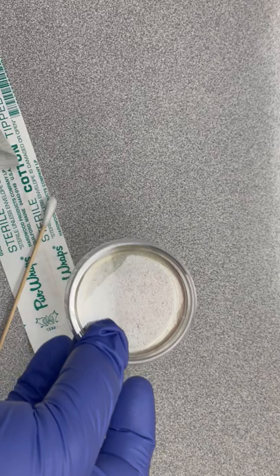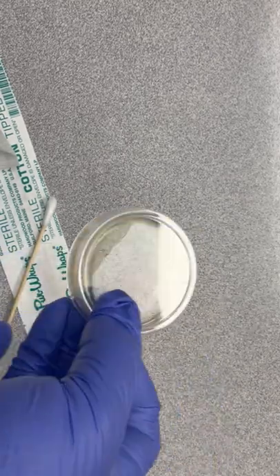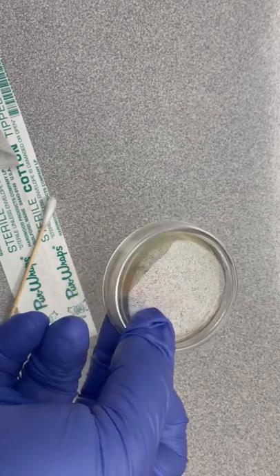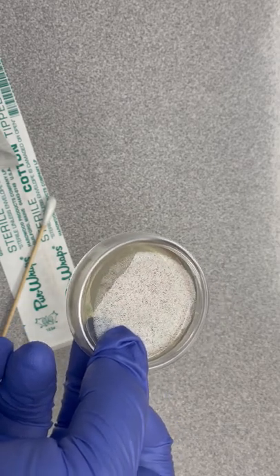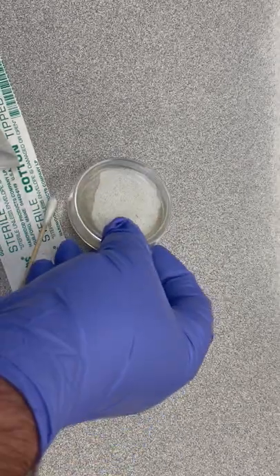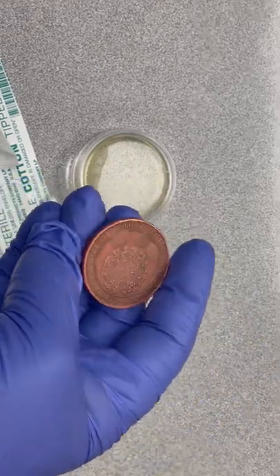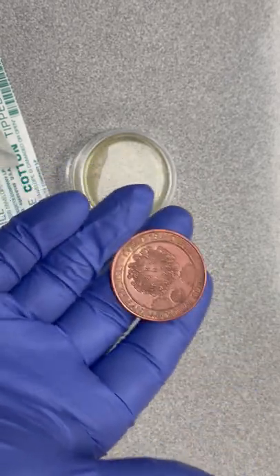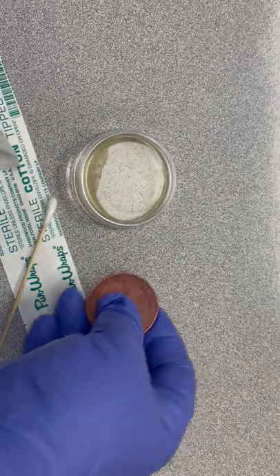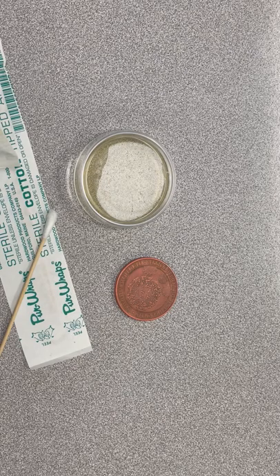On Monday we're gonna see if there's a magic forest growing in here. I was told that over a weekend there may not be a lot of growth, but we will sit and watch it for the whole week and see if anything grows. The experiment is to see if bacteria actually survives on this copper coin — we had a bunch of people touch it and I actually coughed on it. That's the experiment, and we will have a part two to this video uploaded to YouTube next week.